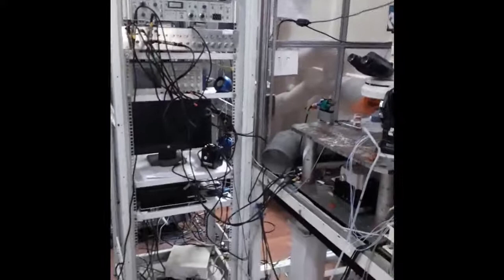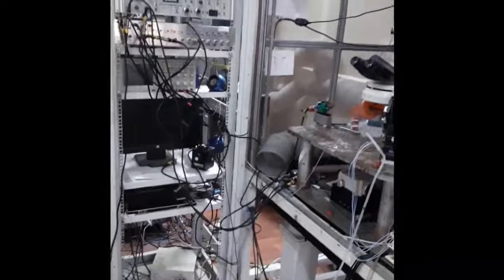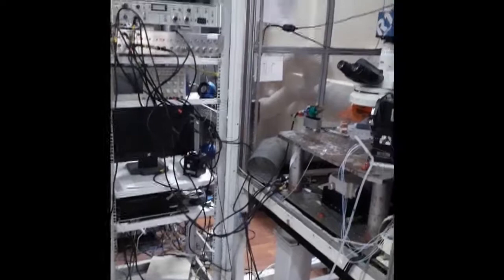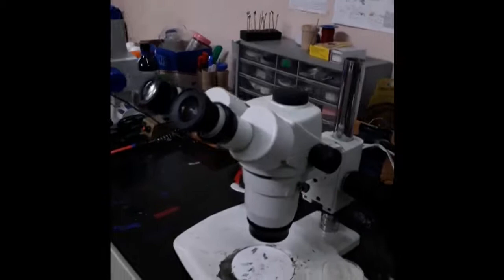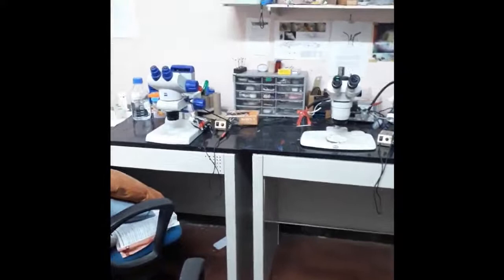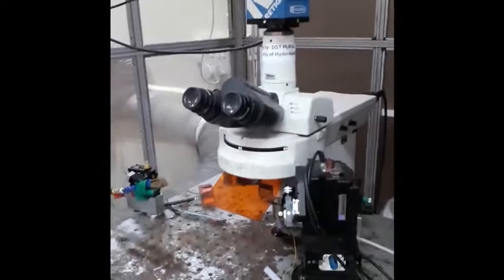Because these animals that we work with are small, naturally their brains are also small. So we have to see, access, and manipulate those brains — we need to do all operations under a microscope. There are two kinds of microscopes broadly used in the lab. One is what is called a stereo zoom microscope — here is one, and here is another. This is our work table in the sense that it is where we usually sit and do our first exposure of the brain, or dissection. There is also a compound microscope, sometimes a fluorescence-fitted compound microscope.